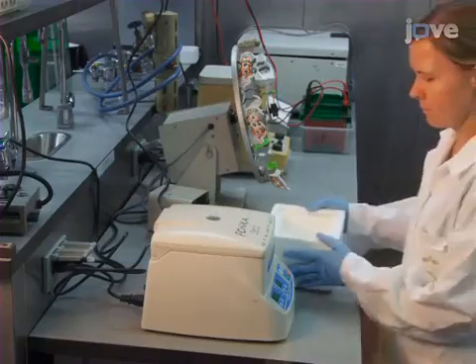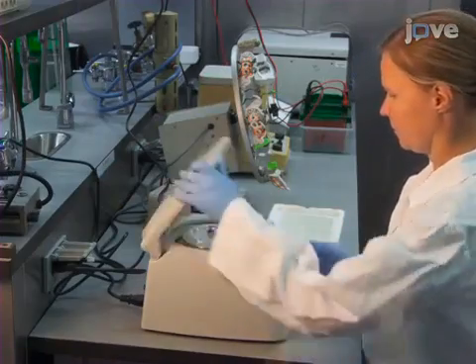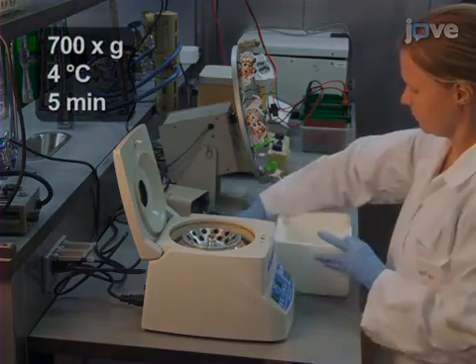Place the tube in a pre-chilled 4 degrees Celsius microcentrifuge. Spin down at low speed for 5 minutes and aspirate the supernatant.